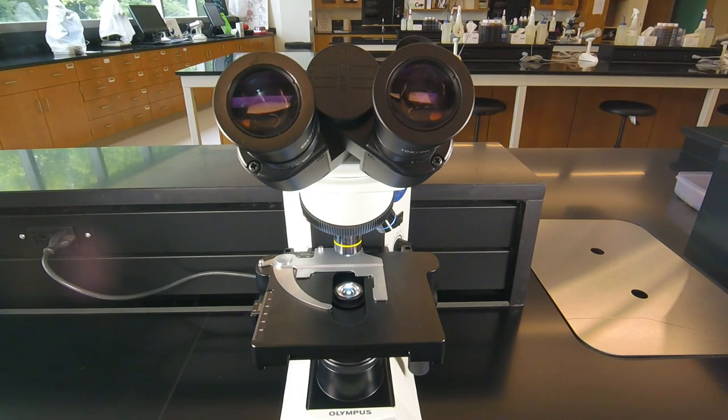That does take a little bit of practice initially to get used to it, but it's well worth the effort. It'll be much easier on your eyes if you're using two eyepieces.